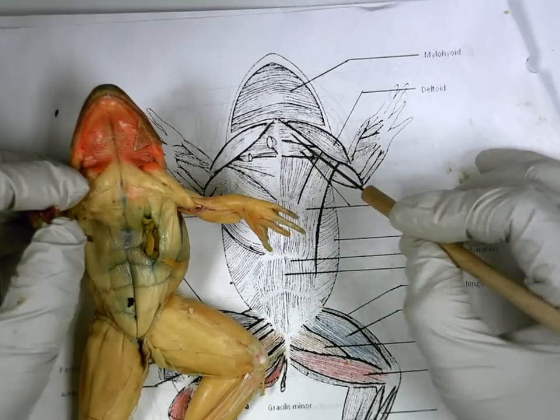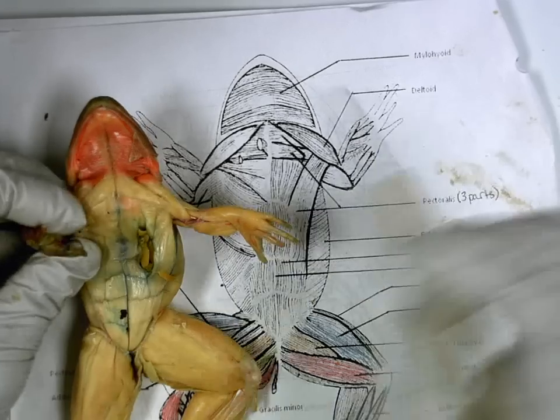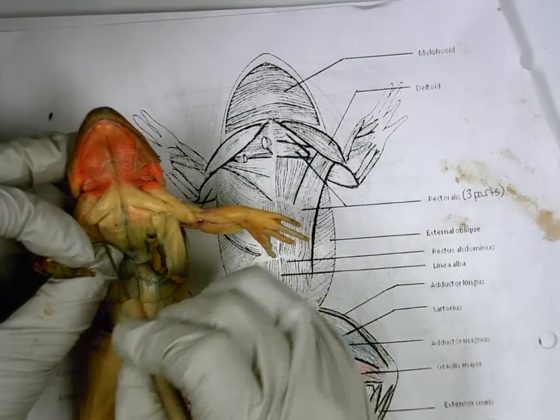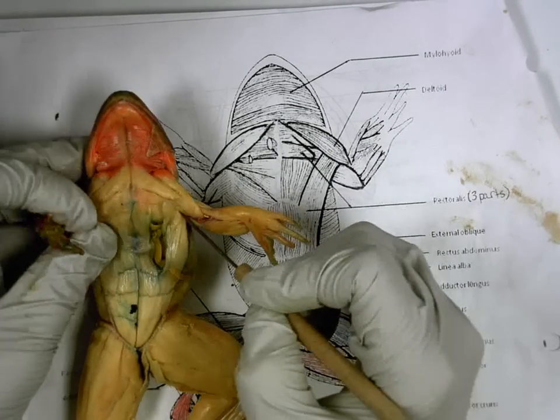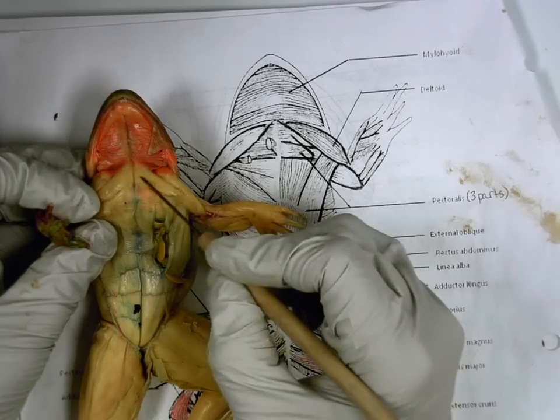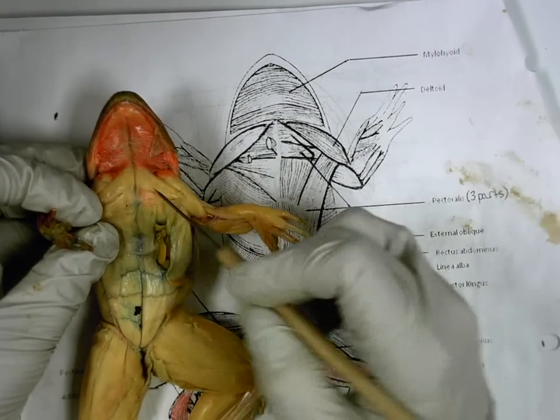Then we have these. There's three of them across the chest twice and down towards the belly. That would be, again, you can see here, I can separate them real nice. You have top one, next one, and this one going down the side. All of these are pectoralis, which are the pecs.